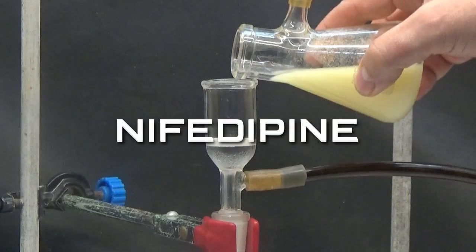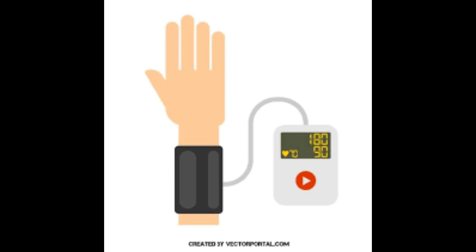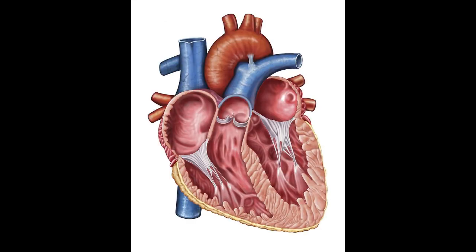In this video we are going to make nifedipine. Nifedipine is a drug called a calcium blocker. It lowers blood pressure and is used against angina pectoris.